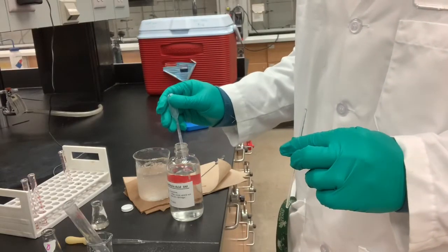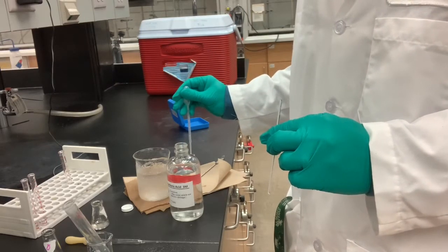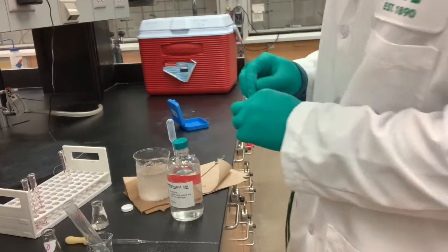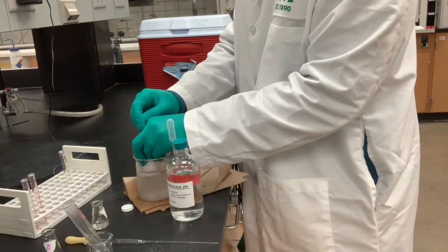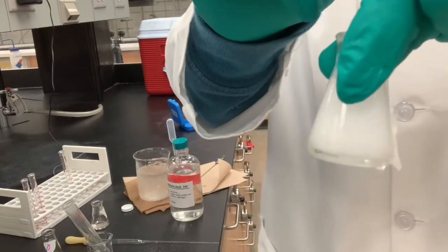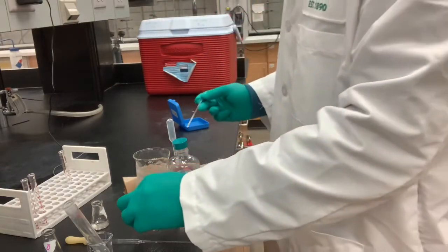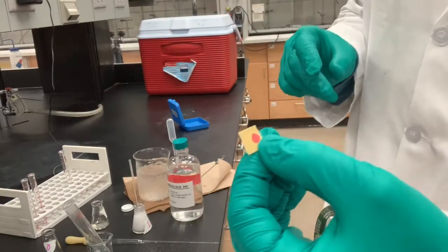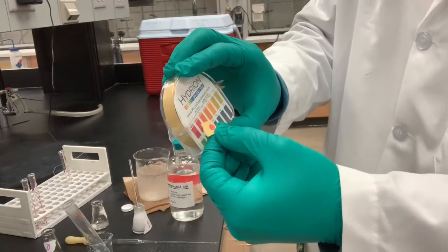So I'm going to take 1 more ml. Put it on ice and stir it. And now you can see that it has become completely cloudy. And then if I touch this, there we go, that's the pH that I want. I have a red pH, so it's a pH of 0 to 1, and that's where I want to be for the maximum amount of yield.